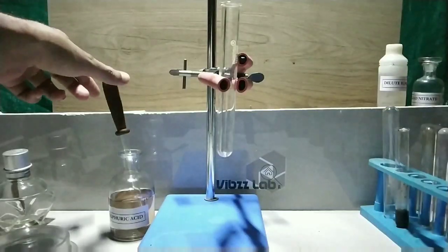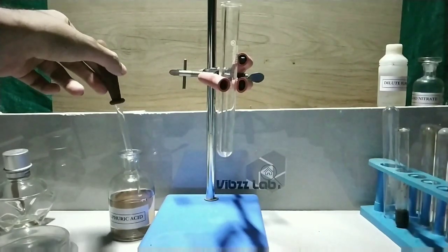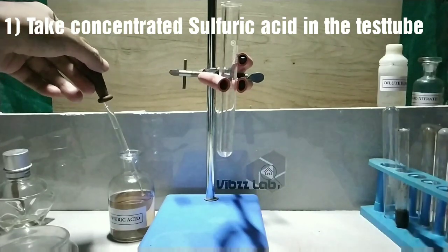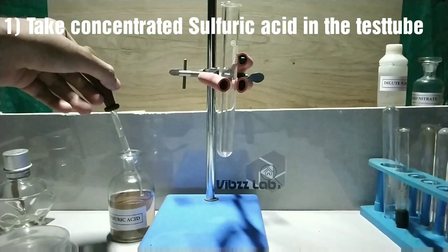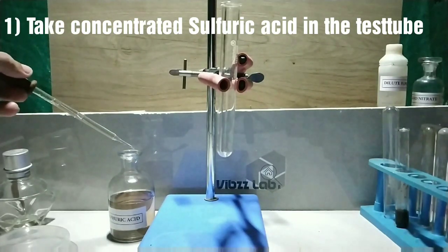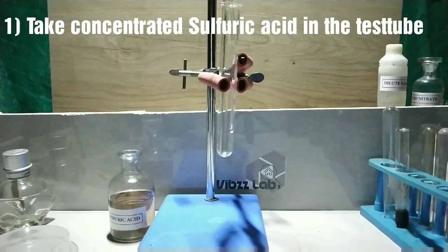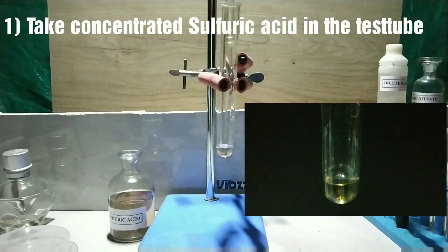We just need three substances for this demonstration. One is concentrated sulfuric acid. Another one is alcohol — here I am using methylated spirit, that is 95% ethyl alcohol. You can also use isopropyl alcohol. The third substance is potassium permanganate crystals.